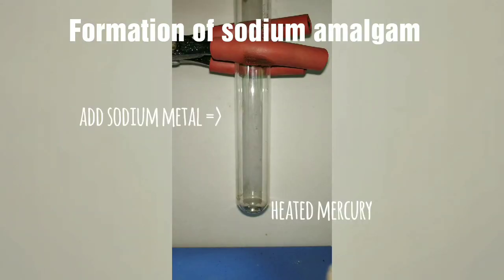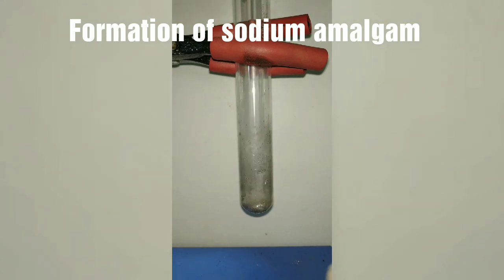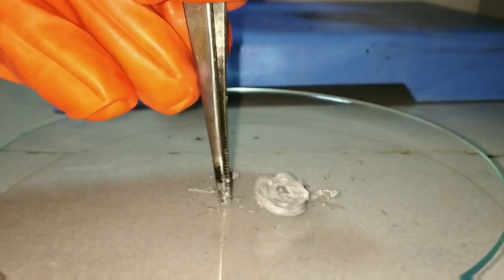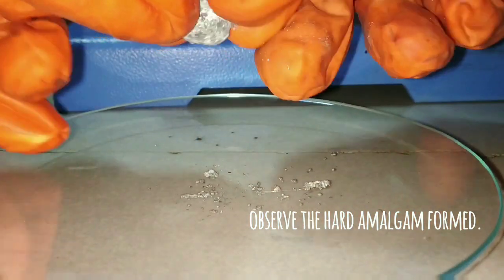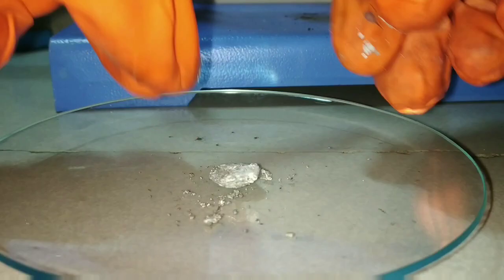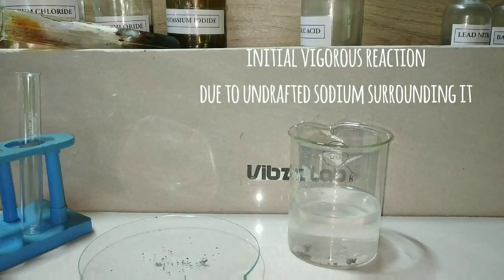Sodium metal reacted with heated mercury, forming sodium amalgam. This reaction is highly exothermic. And after this reaction, the end product formed is a solid chunk of sodium amalgam. The importance of sodium amalgam is in organic chemistry, and this alloy is used in liberation of hydrogen gas, which is less vigorous when compared to sodium in water.